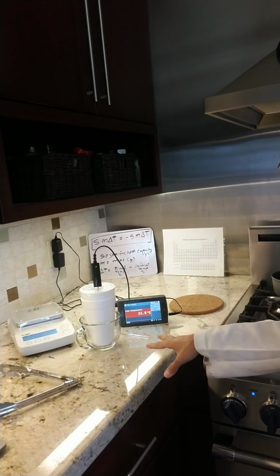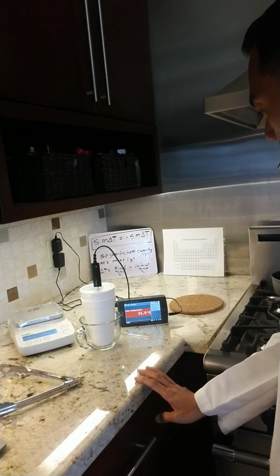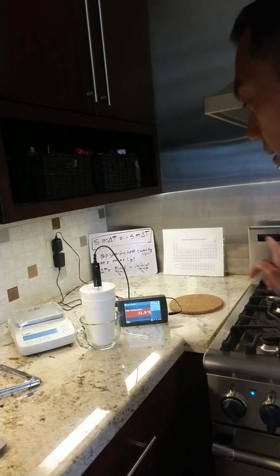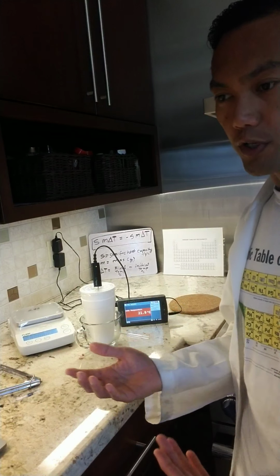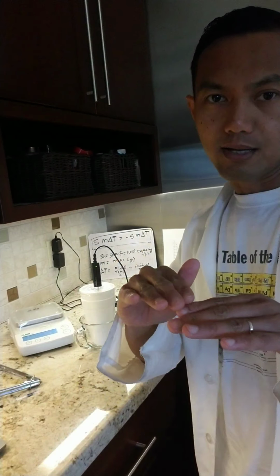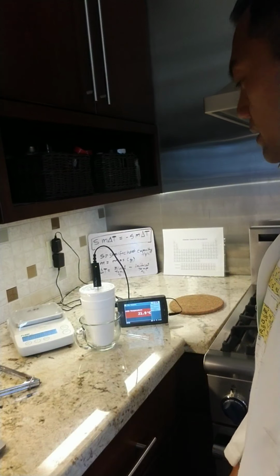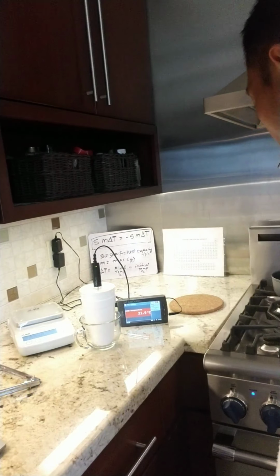There's some change in water temperature, something to factor in, but we'll start with the initial temperature that we mentioned earlier. Now I'm going to add metal A inside our calorimeter, and then there will be a change in temperature. How do we know that we're done recording the temperature? If for at least a couple minutes the temperature is no longer changing. For every 30 seconds I'll point it out. We'll set a timer, and I'll just use the clock that I have here. So I'm going to start right now.